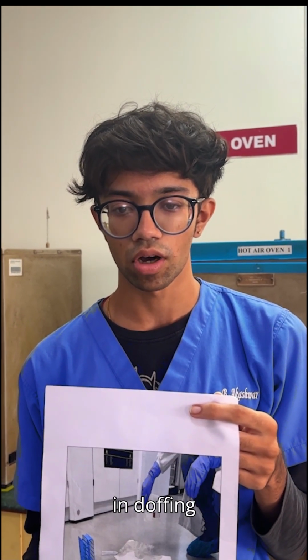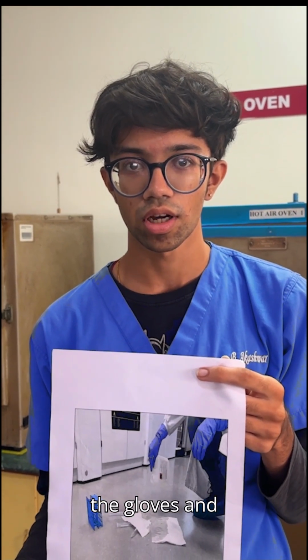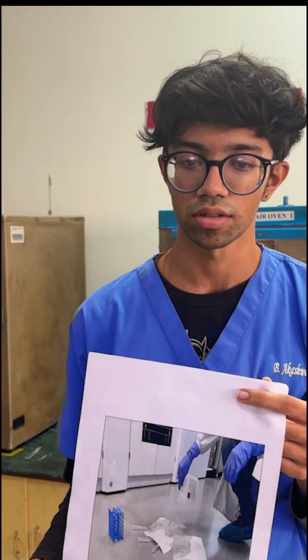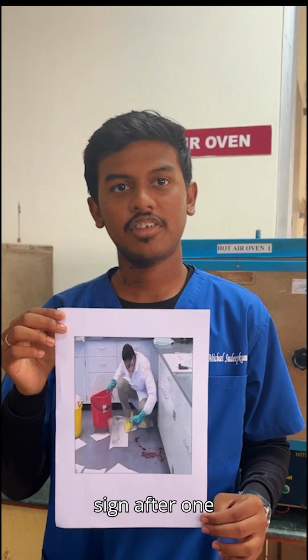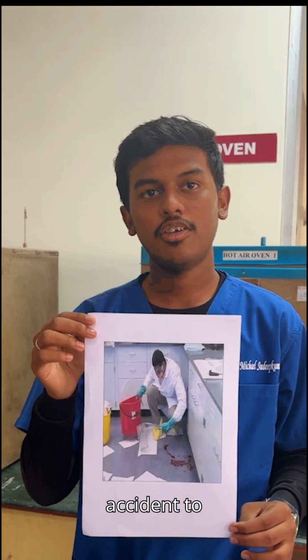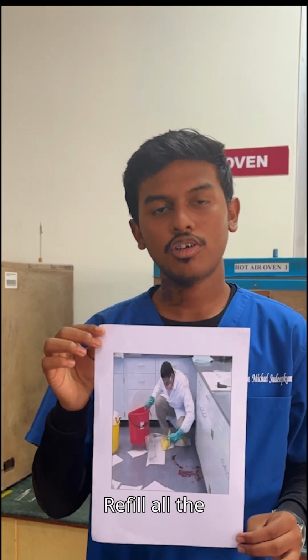Carefully remove the PPE in doffing sequence and put it in the appropriate biowaste container. Finally, remove the gloves and put them in the appropriate biowaste container. Perform hand wash. Remove the no entry sign after 1 to 2 hours once the aerosols have settled. Report the accident to the Infection Control Committee. Record it as a document. Refill all the components of the kit.